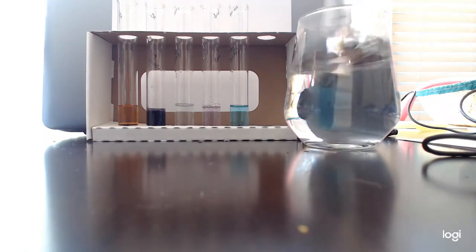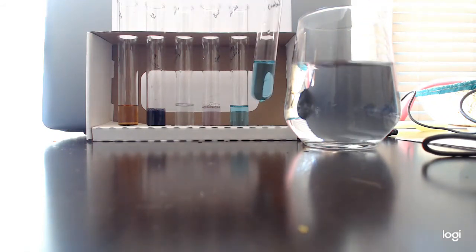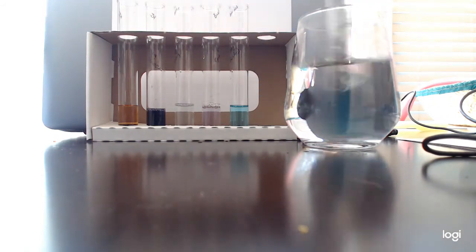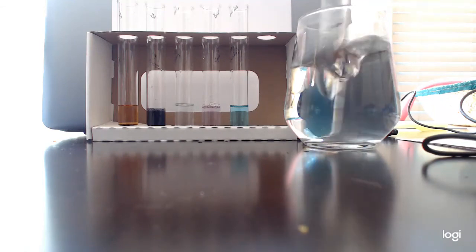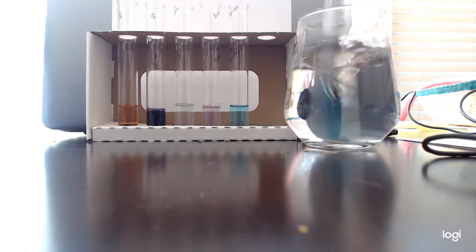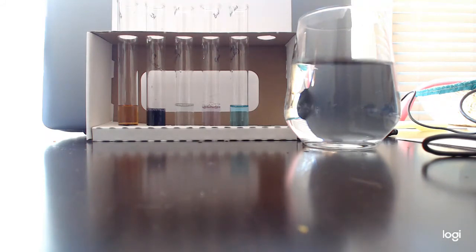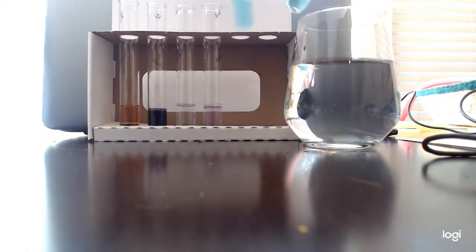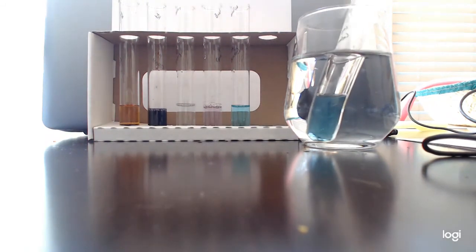I know, this should be boiling, guys. I'm sorry. Maybe I can boil some water. What do you guys think? I could boil some water for you guys. Maybe I'll go boil some water. Hang on.